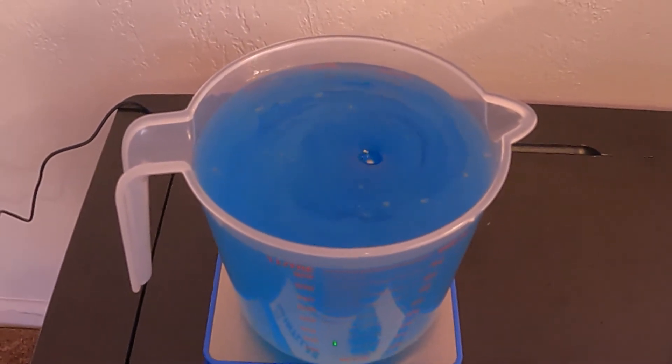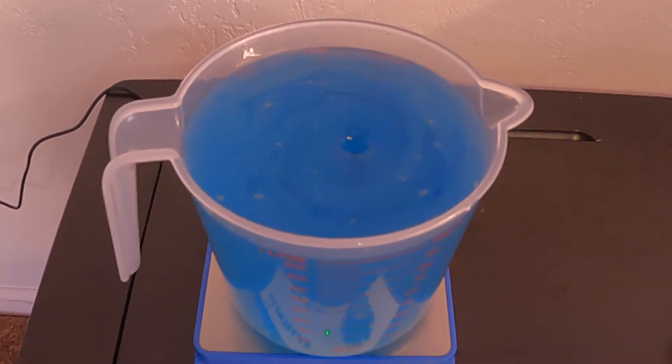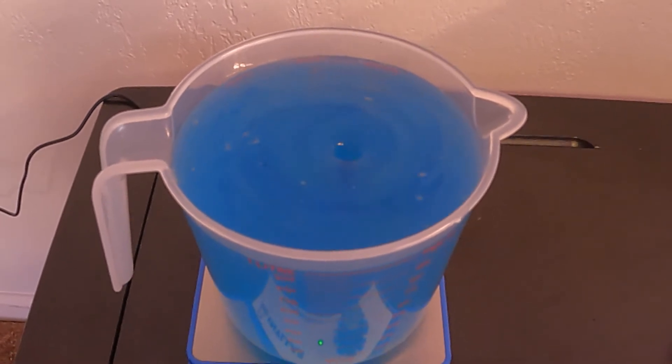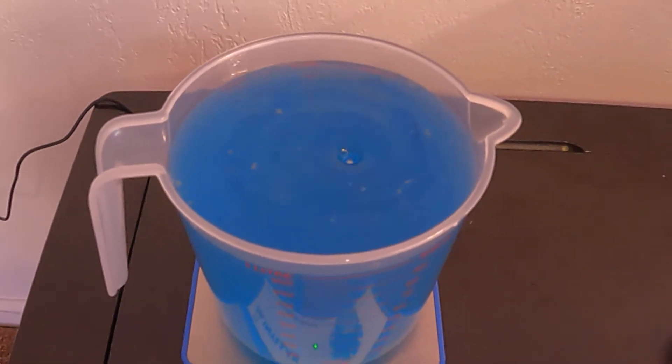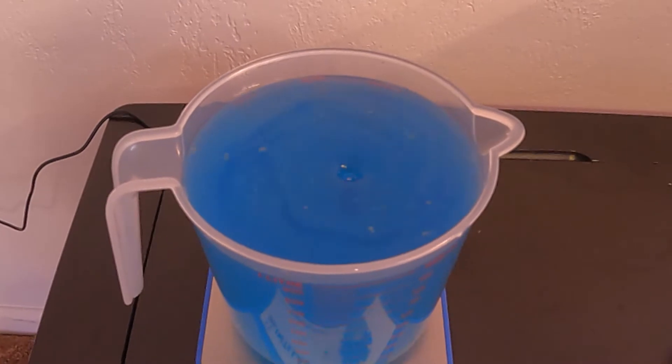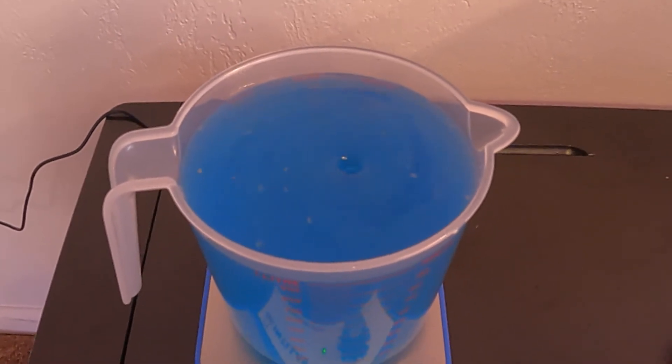I've added three drops of food coloring to my media to make sure that it's identifiable to me as philodendron. This is an unnecessary step but it helps me keep track of my different types of media.